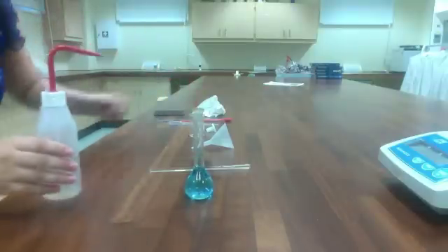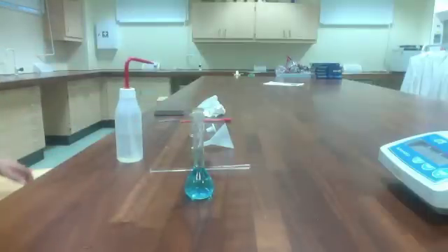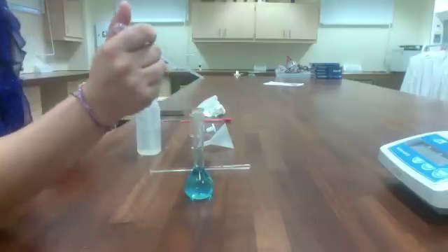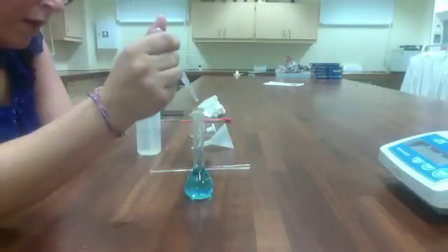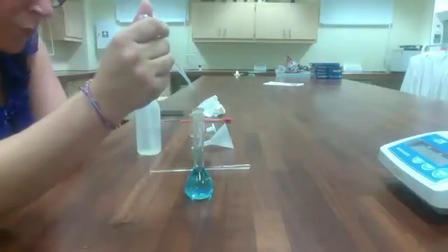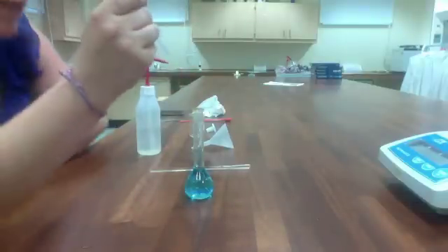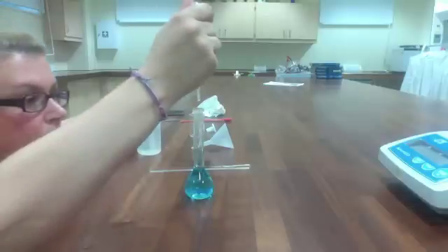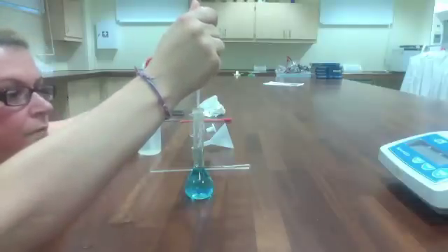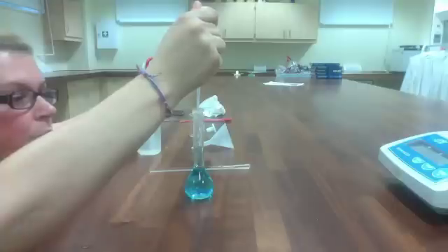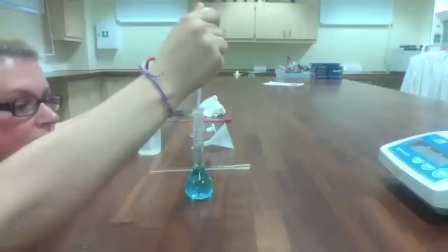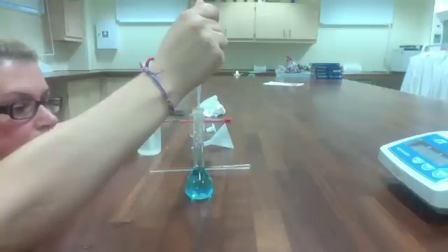Once I get within a few milliliters of the mark, you may wish to add drop by drop the remaining amount of water. It's really important that you get yourself at eye level with the mark so that you can read the meniscus properly and add very carefully. This should be the person in your group with the steadiest hands and best vision. Remember, when we read the meniscus, we read from the bottom.